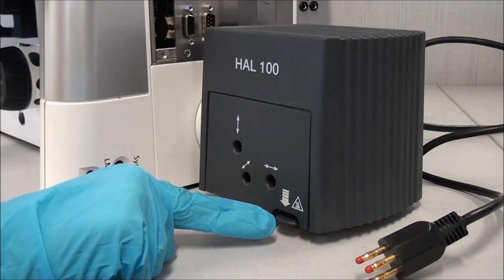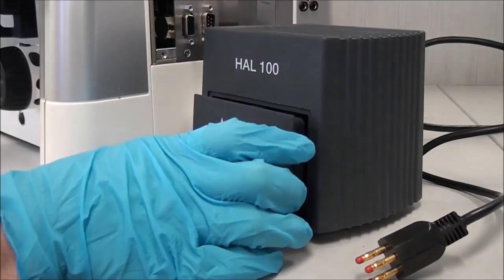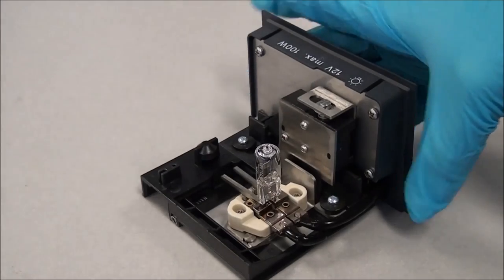Depress the unlock lever found on the lower right-hand side of the housing. The spring-loaded tray will pop out. Remove it by gently pulling straight out and place this tray on a flat surface.